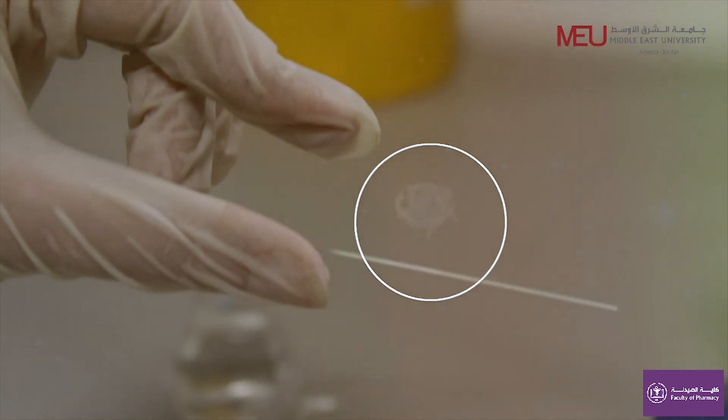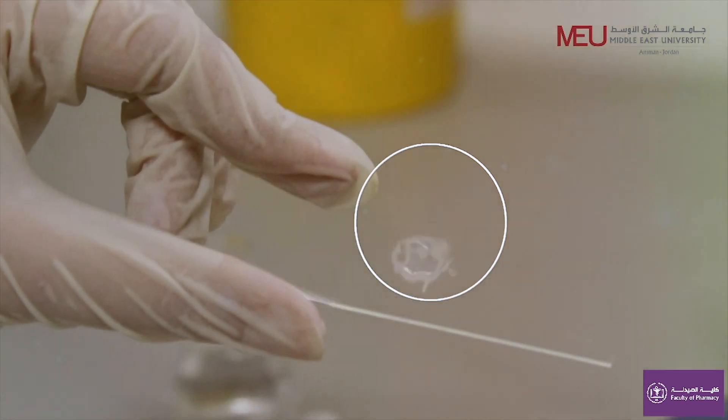Like this, your smear is ready to perform gram staining. Thank you.